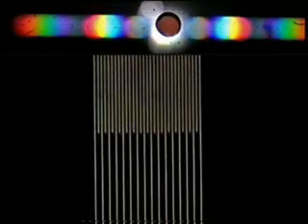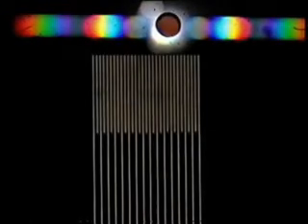Some people, when they see a dark field image, say that the contrast is reversed. On the basis of what you see before you at the moment, I expect you could agree with that. And at the moment the contrast is reversed, but that isn't the general case.